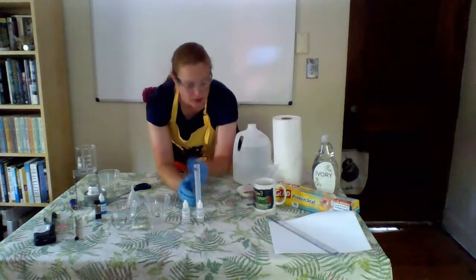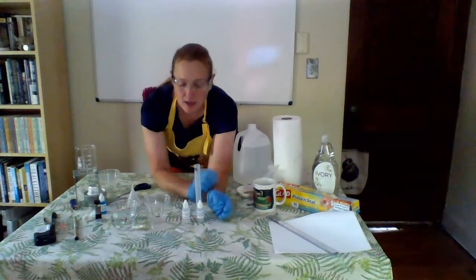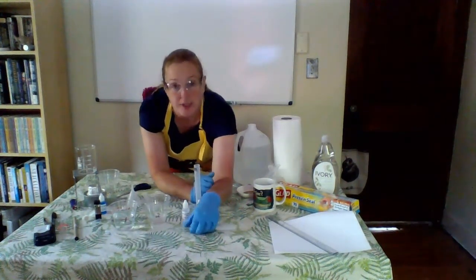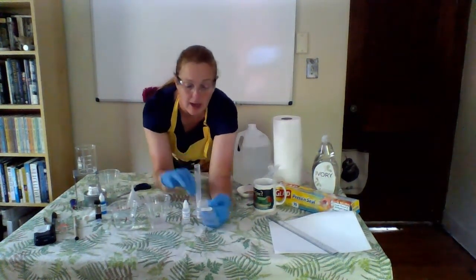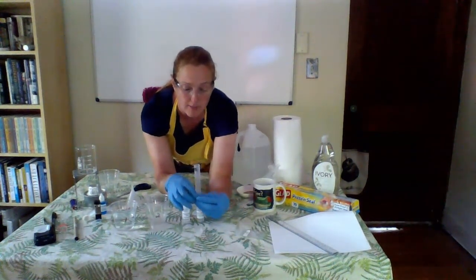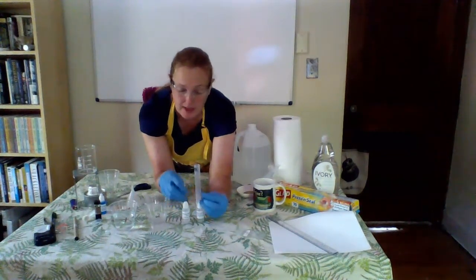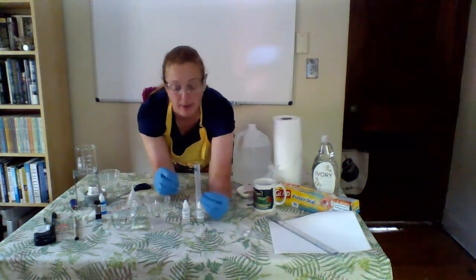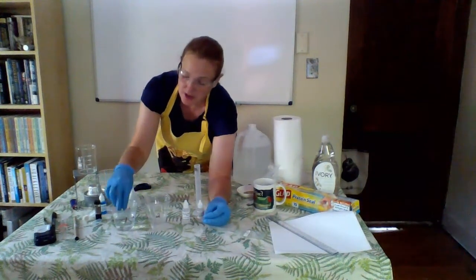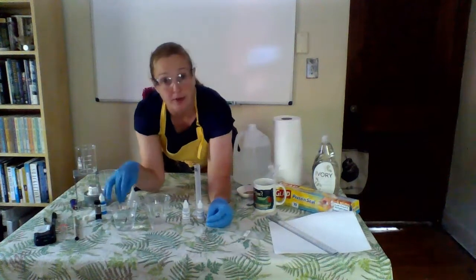Now for experiment 2, as I mentioned before, we are going to be making a model cell. And in order to do this, we're going to use the dialysis tubing. Now this is the dialysis tubing that they use for people whose kidneys are struggling and starting to fail. And this is essentially a semi-permeable membrane. It's going to let certain things go through. And when you first unfold it, you're going to notice it's super crinkly.